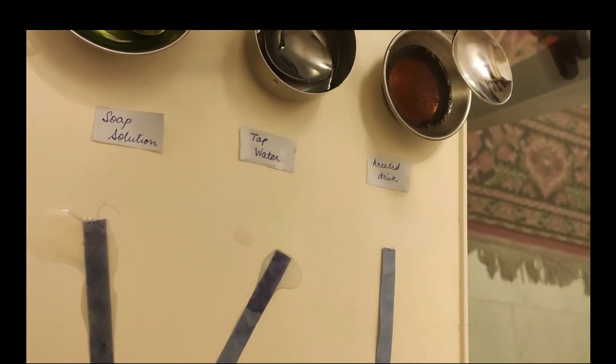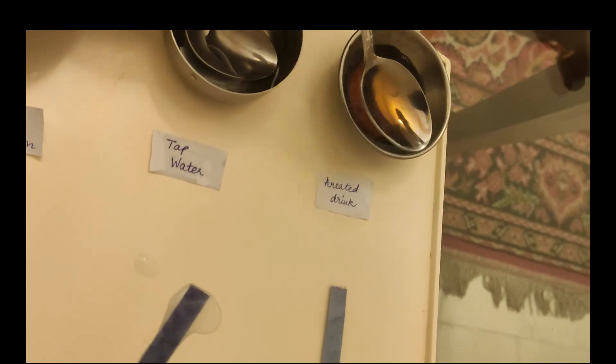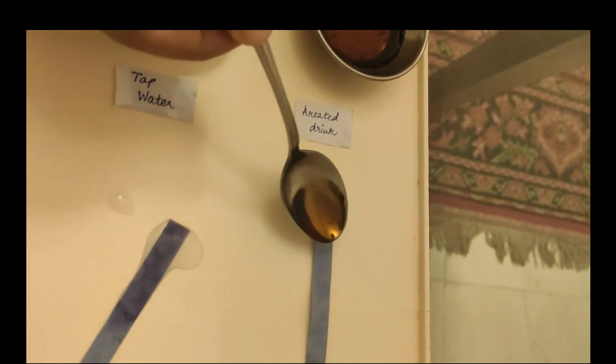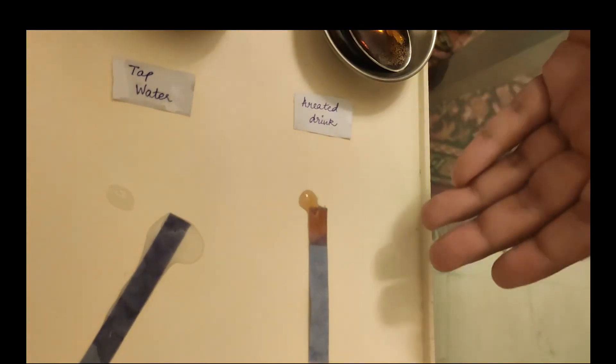And now, for the carbonated drink or the aerated drink. As we can see, this is also an acid.